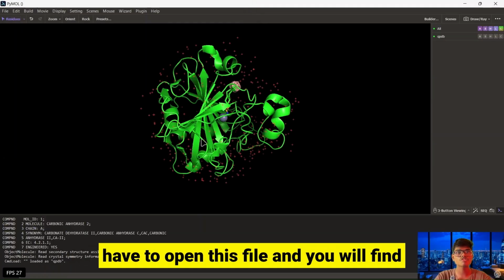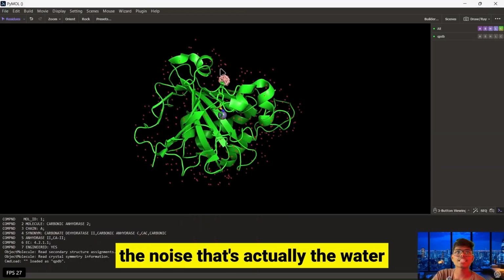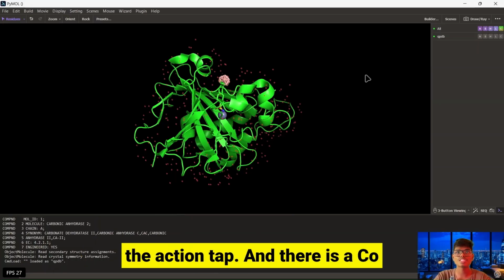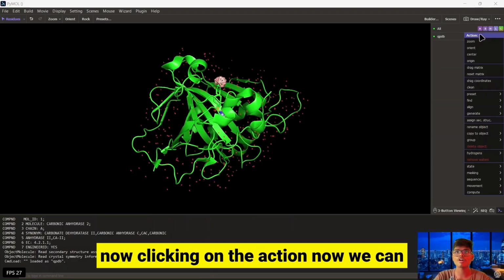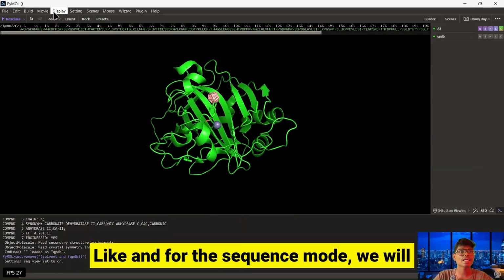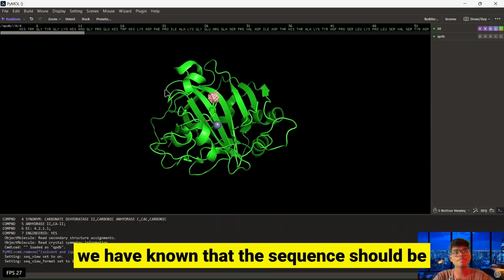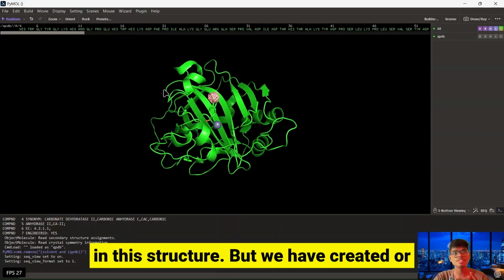We have to open this file, and you will find there is some type of noise. That's not noise, that's actually the water molecules present over there. We can remove the water molecules using the action tab, and there is a co-crystallized ligand over here also. So clicking on action, now we can remove the water. The red color content has been removed. Now you can display the sequence, and for the sequence mode we will choose the residue name. You will find the sequence starts from 4, and we know that the sequence should have 1, 2, 3, so those 3 residues are missing in this structure.